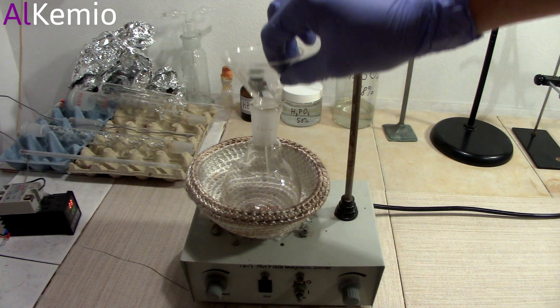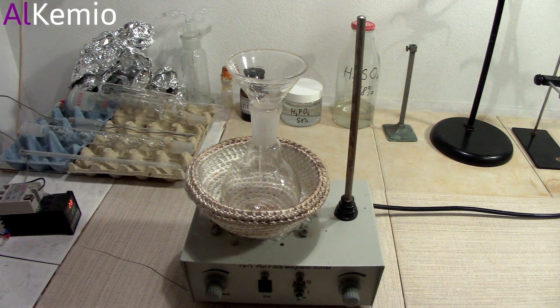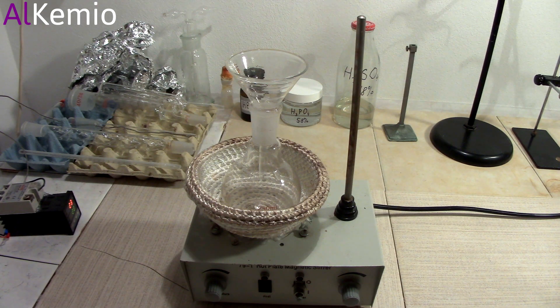After a few days of drying I decanted everything into a round bottom flask and started the second distillation.